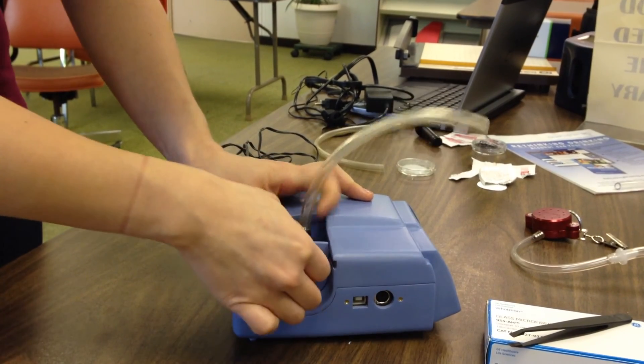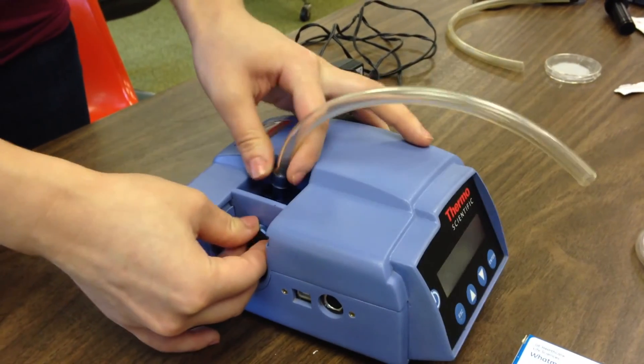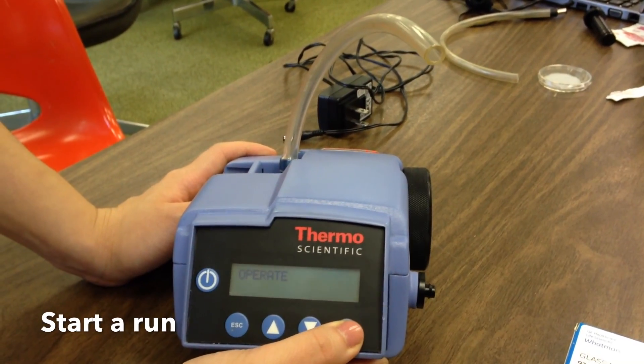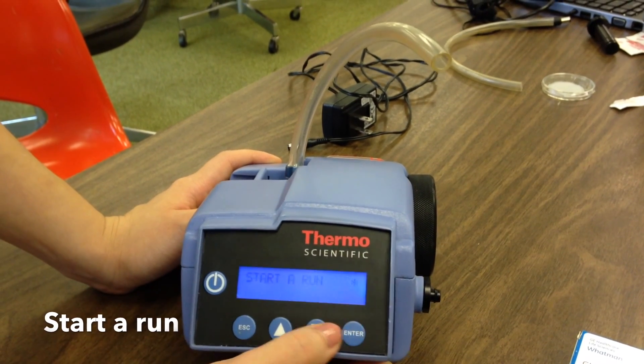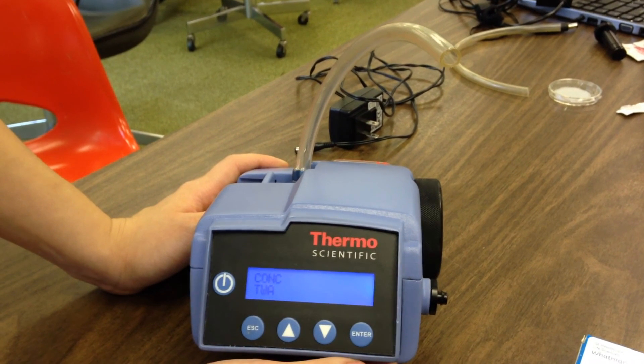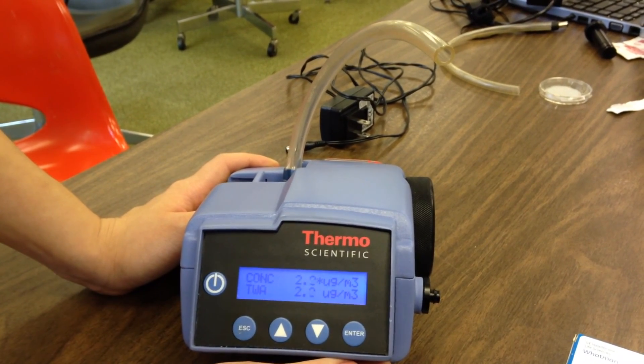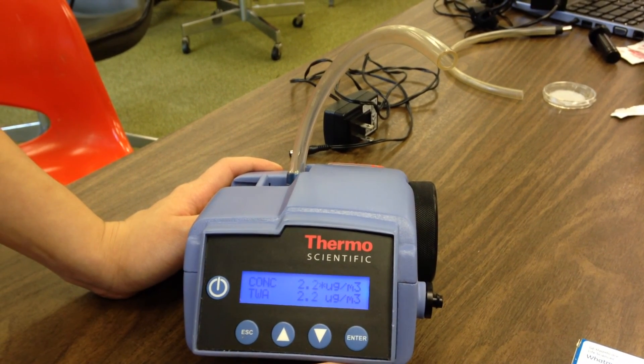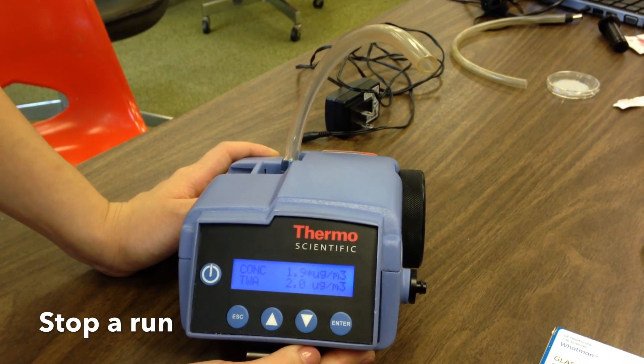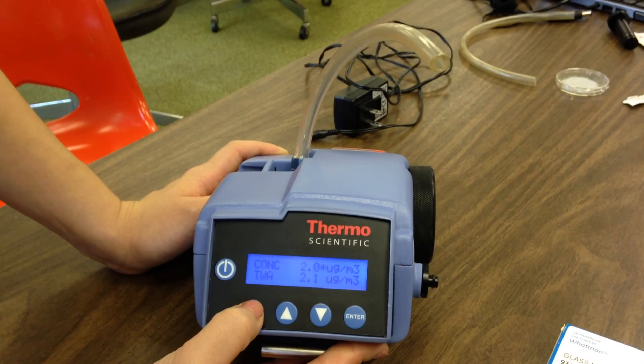Press and hold the ON-OFF key for 4 seconds on the main screen until you hear a beep and the screen turns on. On the OPERATE menu, scroll down to start a run and press ENTER to begin reading. Press ESC to stop a run and then press ENTER to terminate the reading.